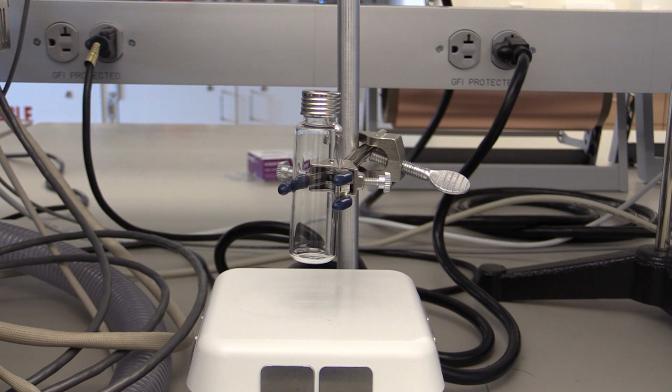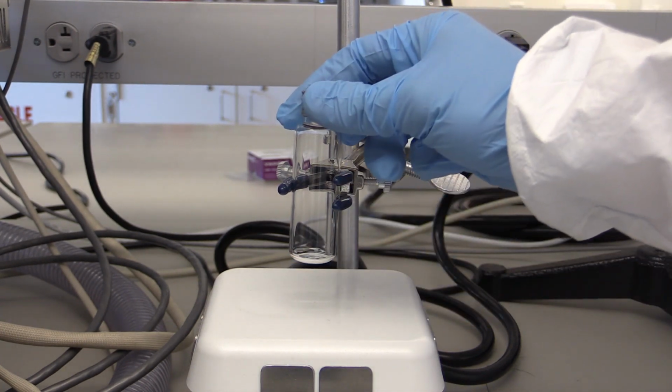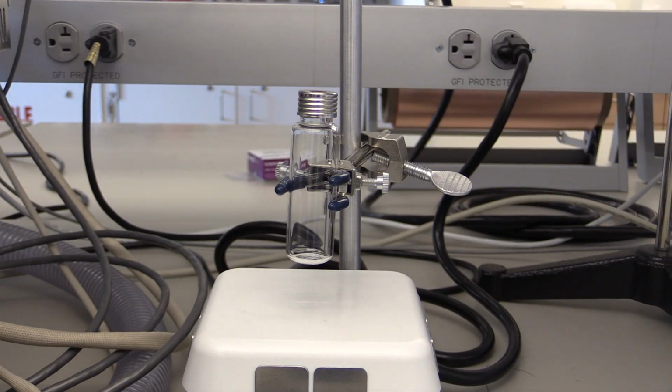The RTGA has primarily been used for the Energy, Materials, Devices, and Systems course, and primarily for the photocatalysis module of the lab. In that lab, we are trying to measure photocatalytically produced hydrogen gas, so we use these gas-tight vials that have screw-top caps with septa on the top.